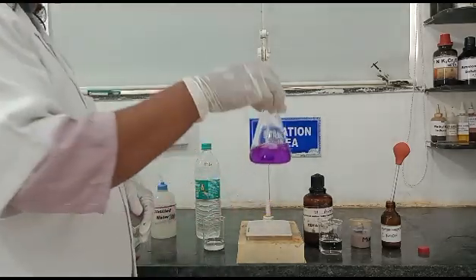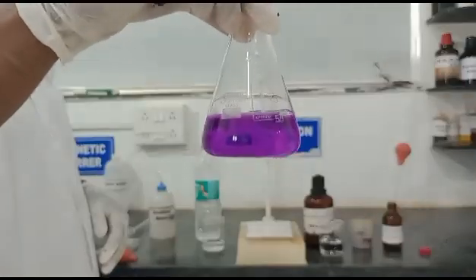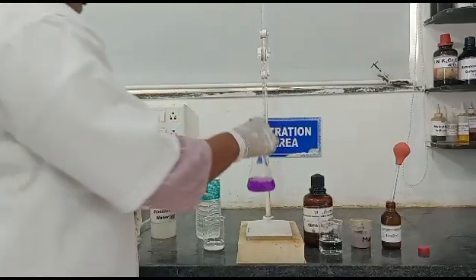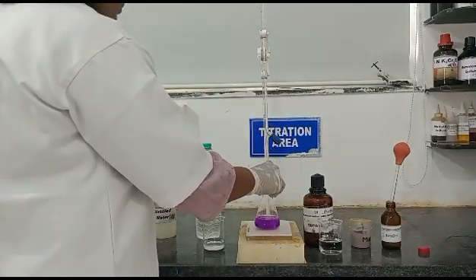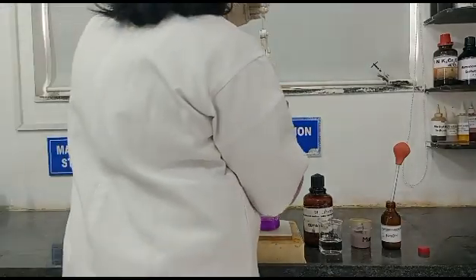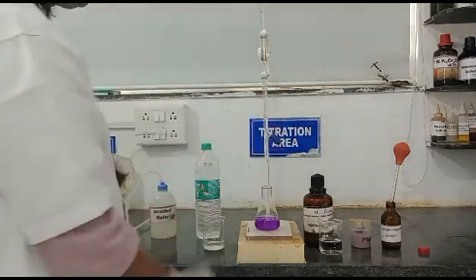You can see the endpoint here — it is purple colour. Note down the burette reading, and we will calculate the calcium content.